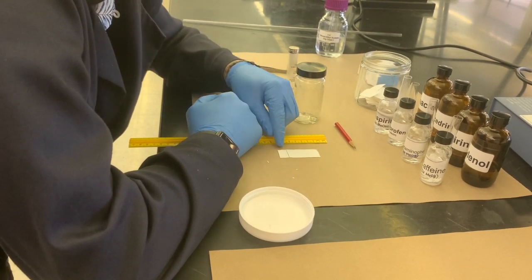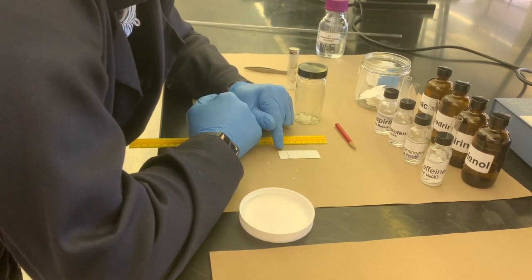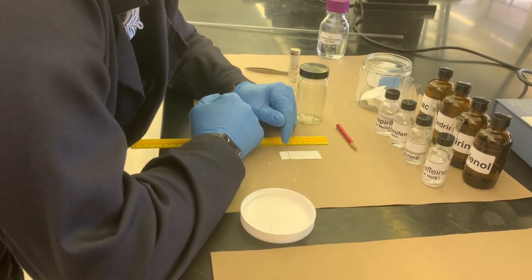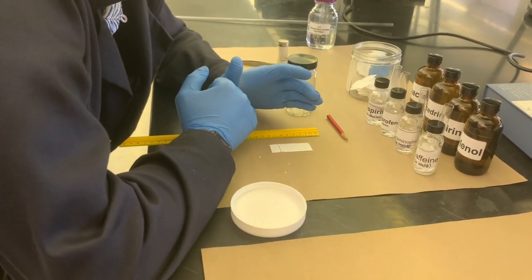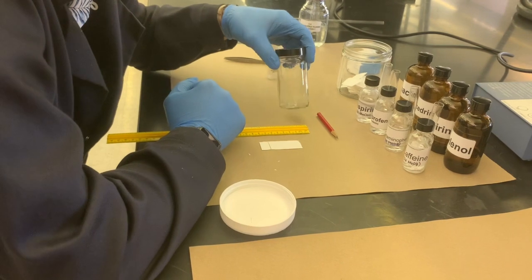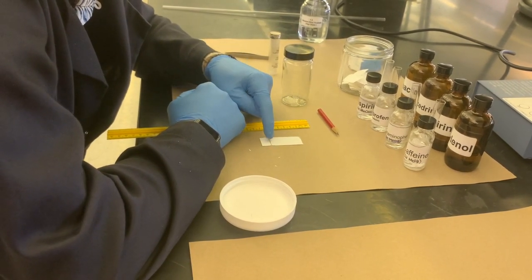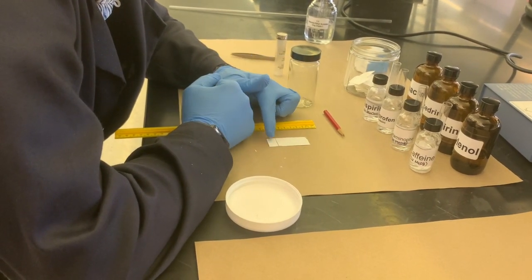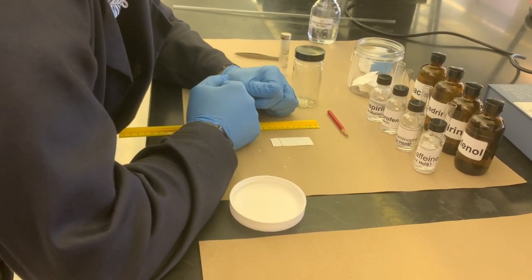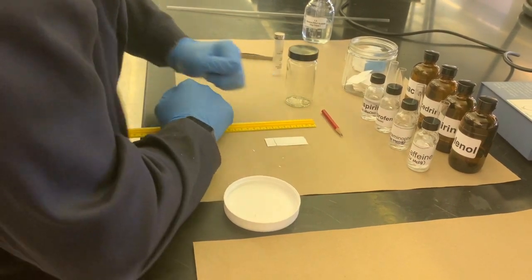If you actually allow the eluent to lap over the starting point, it's going to wash all of the starting products back to the eluent pool, which is not what you want. You're just going to have a mix of all of the different compounds you had on the starting lines already mixed together and moving up and down the plate, and it's going to cause a lot of other problems.